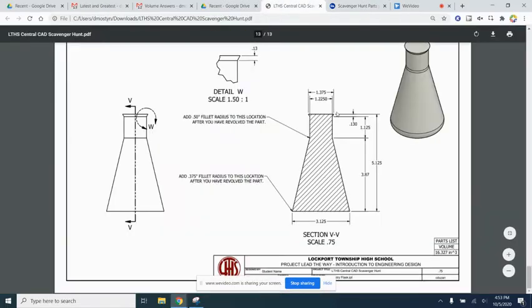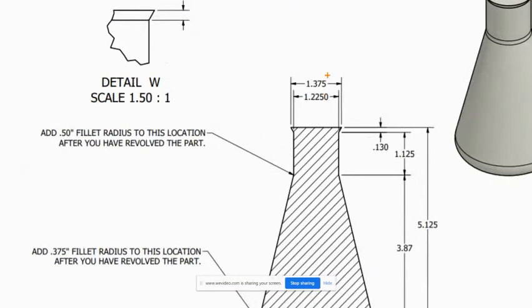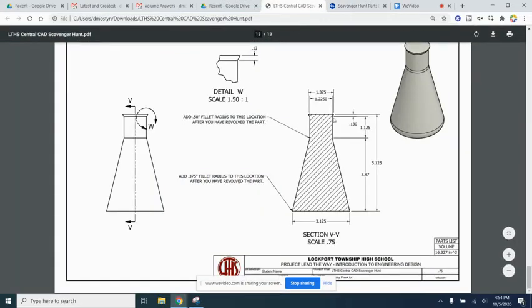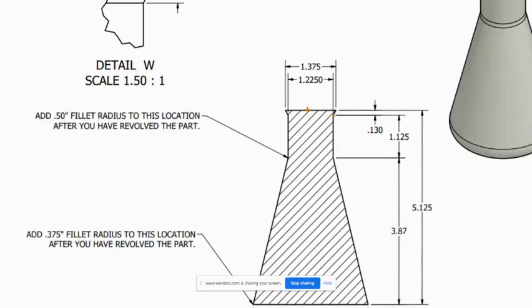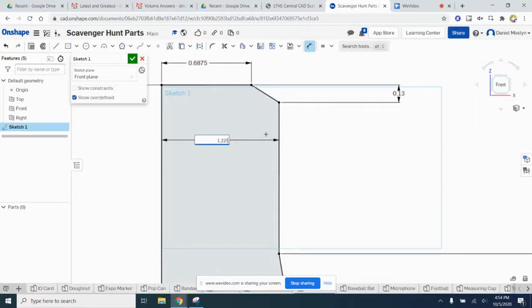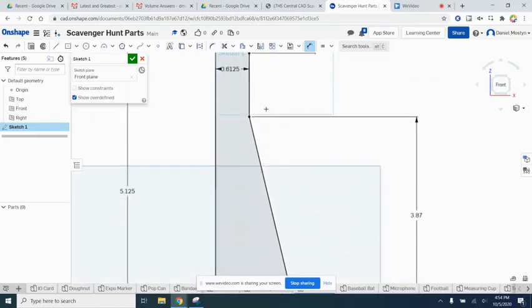All right, maybe we could get the top dimension as well, this thing right here. Let's check that out. The top dimension looks like it is 1.375 divided by 2. 1.375 over 2. And we could also get this. See, this is looking goofy now, so we have to fix that. So this dimension is going to be from here to here, half of 1.225. So we'll come back over here. 1.225 over 2. There we go. That's looking better.